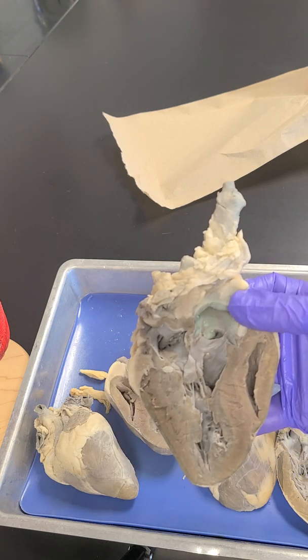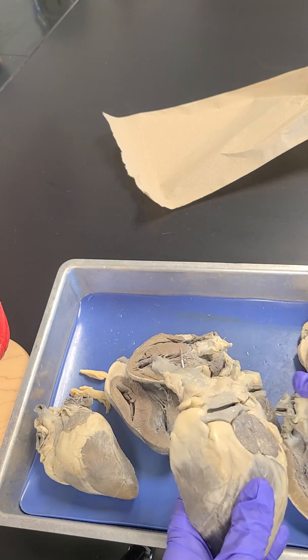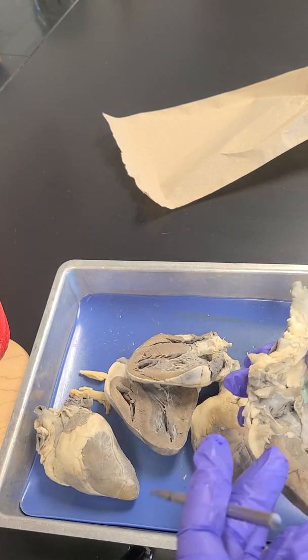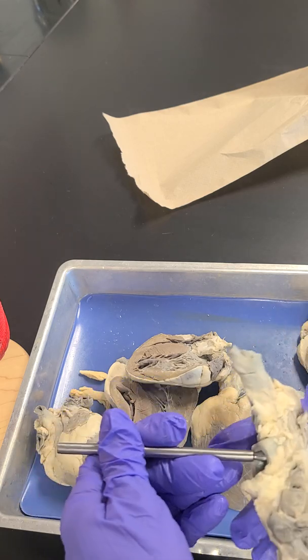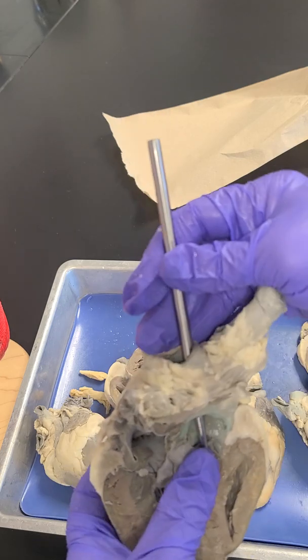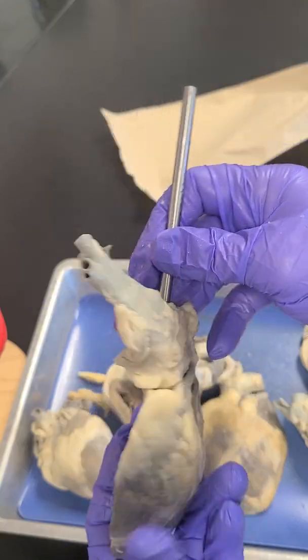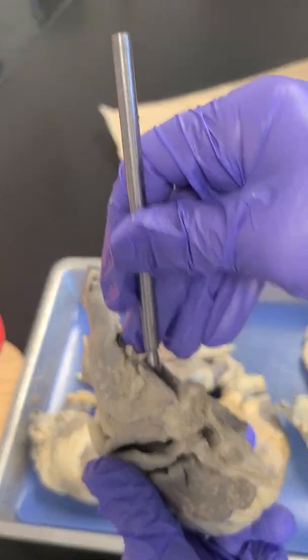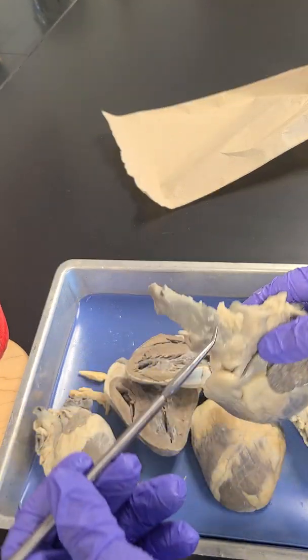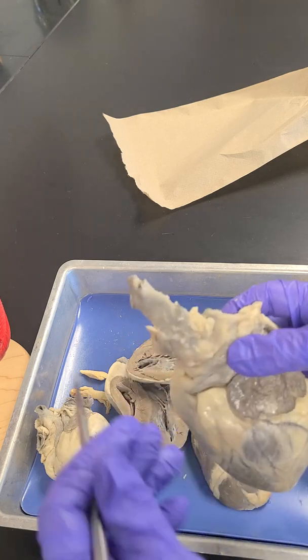Okay, so now we're going to look at actual blood vessels. So let's go ahead and name this vessel right here that we were talking about, that this valve closes. So here's the vessel, here's the front part of the heart, here's the vessel here. It's connected to this vessel, so this vessel comes off of it. These are connected together.